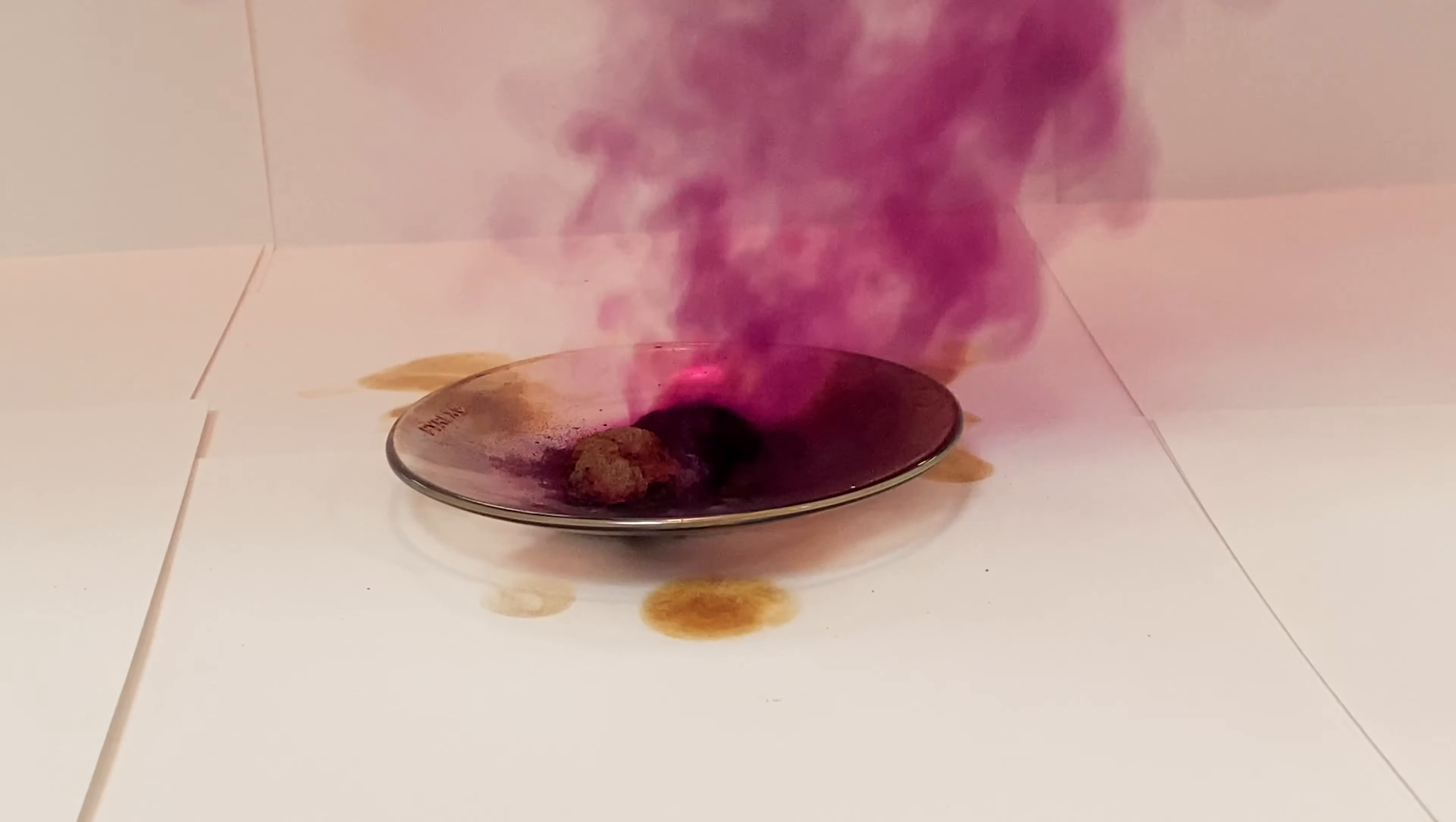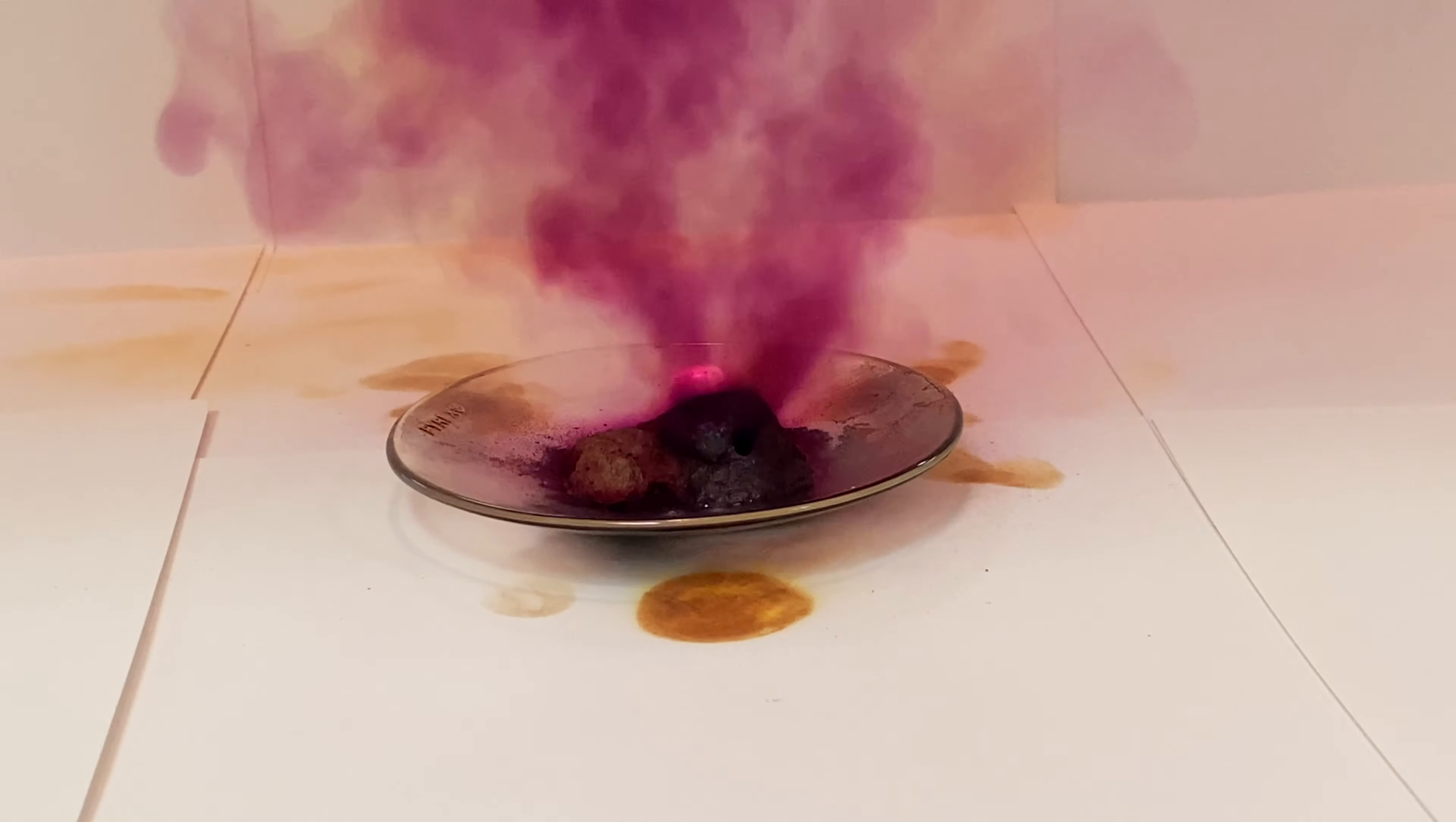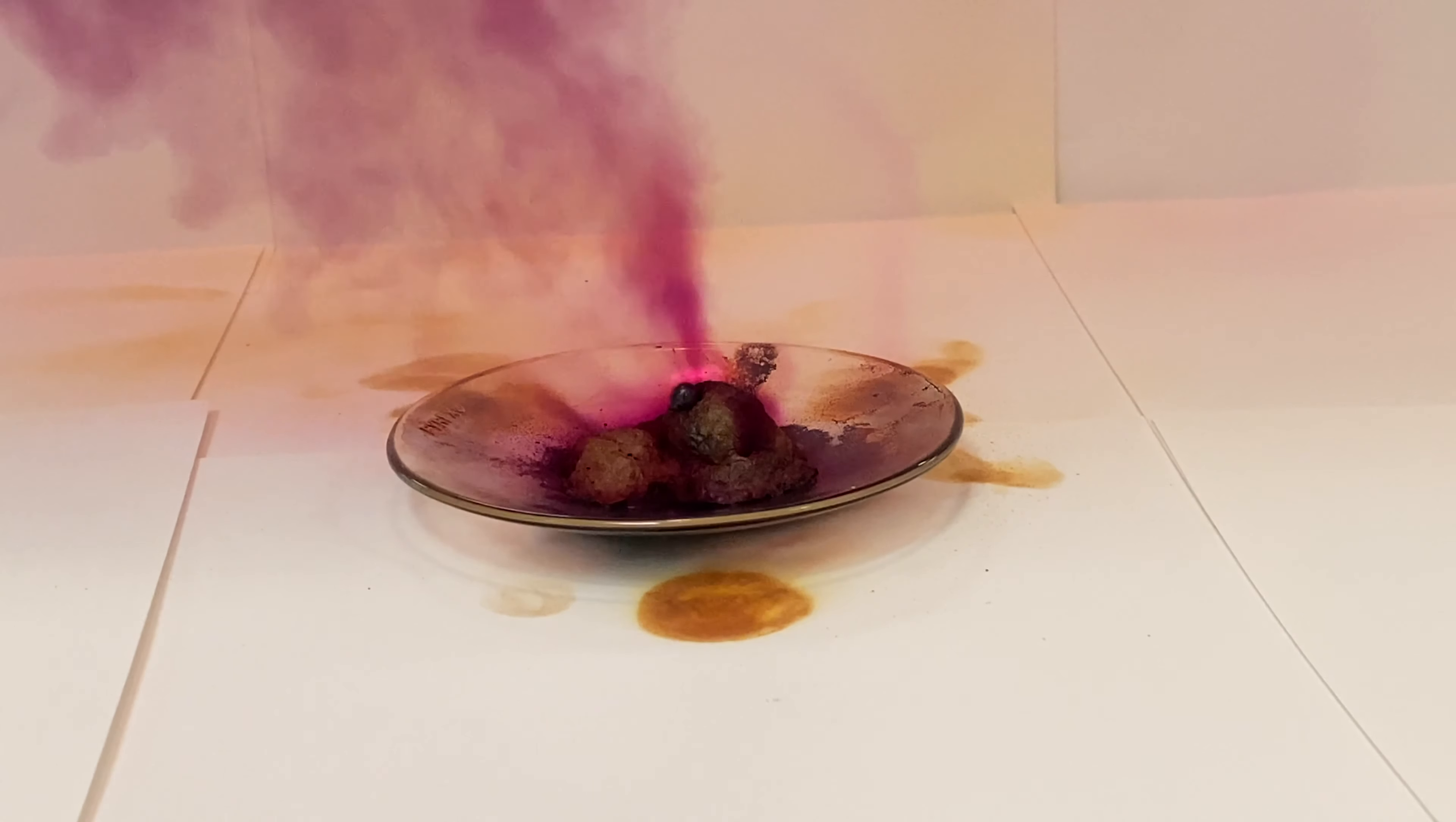The gas that you see coming off is actually elemental iodine being turned into a vapor because of the heat that's being released by the reaction. This is not technically a product of the reaction.